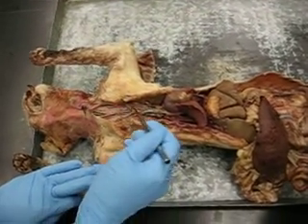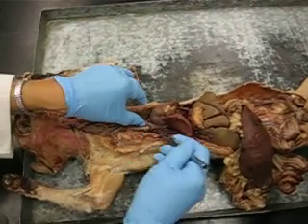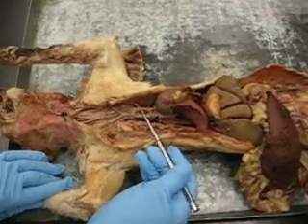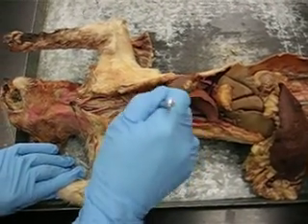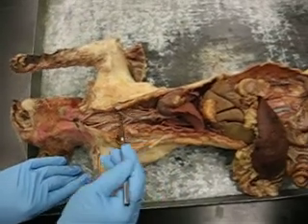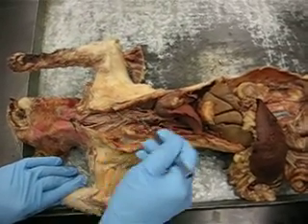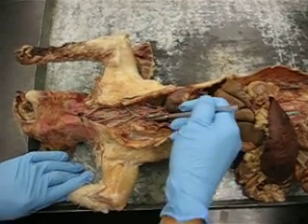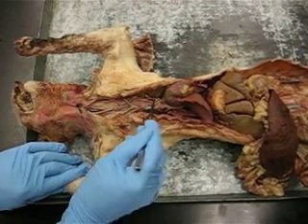Superior Vena Cava Vein, Brachiocephalic Vein, Azygos Vein. Brachiocephalic Artery — it divides into three: into a left common carotid artery, a right common carotid artery, and a right subclavian artery that you see here. This is your left subclavian artery.